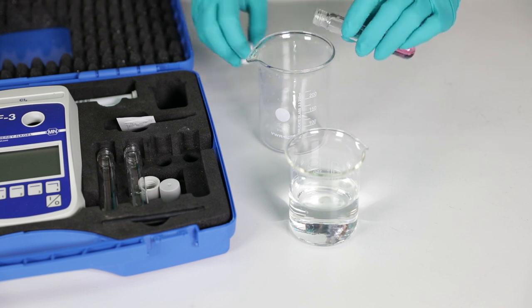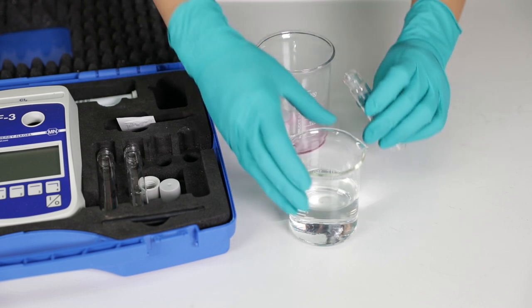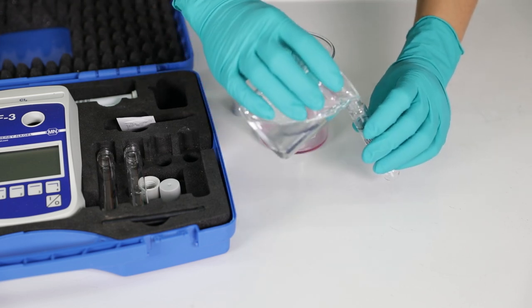Drain the cuvette. And don't forget to rinse it, so that the next user has clean equipment again.